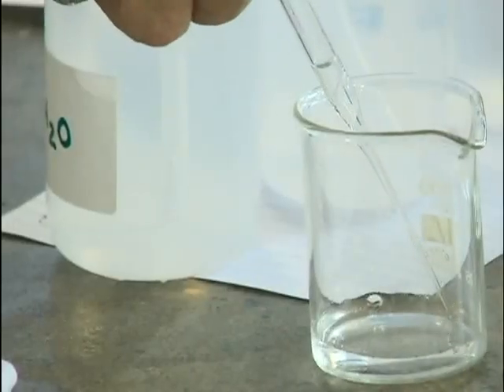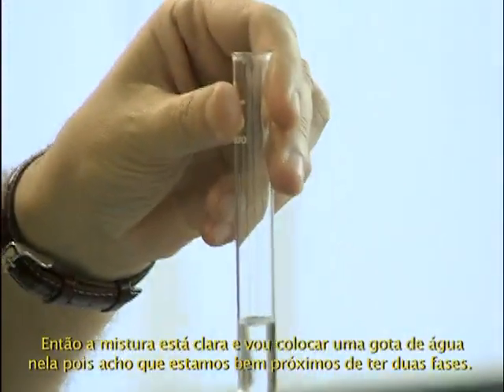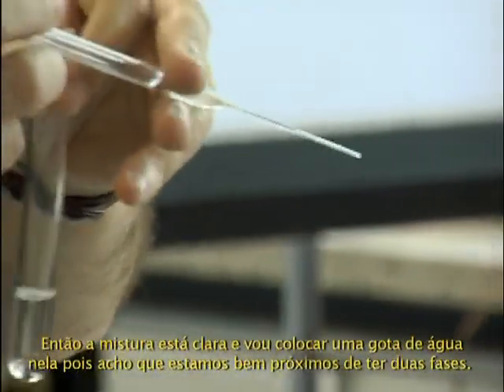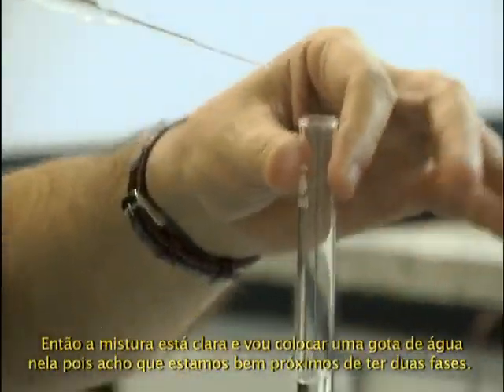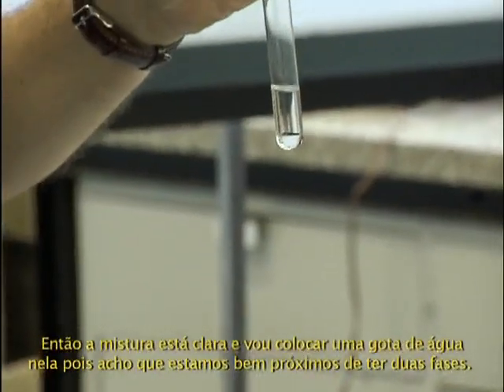Put zero again, and now I will drop water in this mixture. This is water. Yes. So that's clear. I put 1 drop of water in it because I think it's very close to when we get two phases.